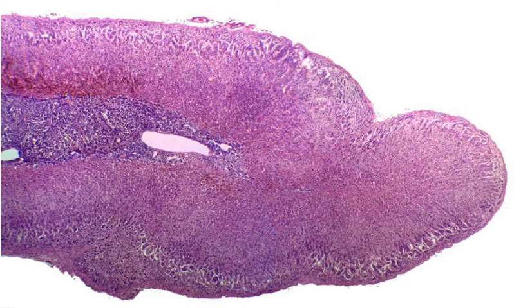This is a slide of the adrenal gland, also known sometimes as the suprarenal gland. The current magnification is 20x total magnification. What we'll be looking for are the different layers inside the gland, as well as any distinguishing features. So what we're going to do is take a look at what we see on this overview to start with.